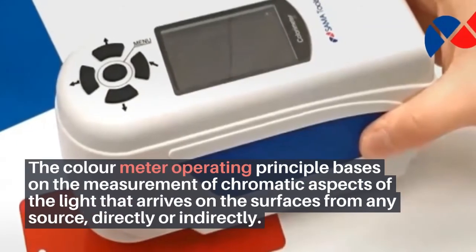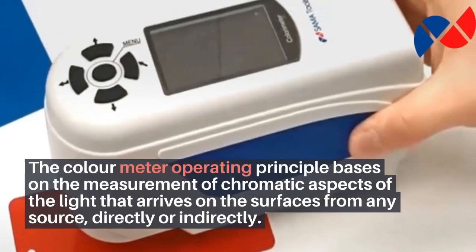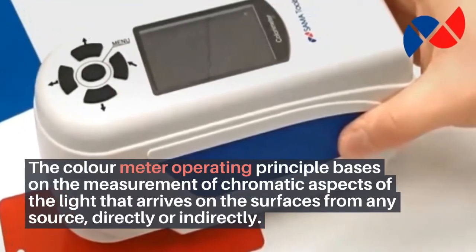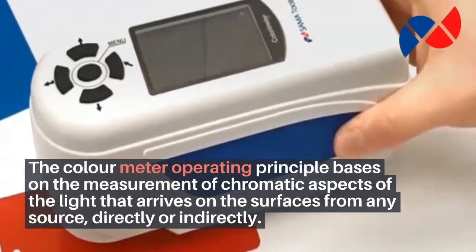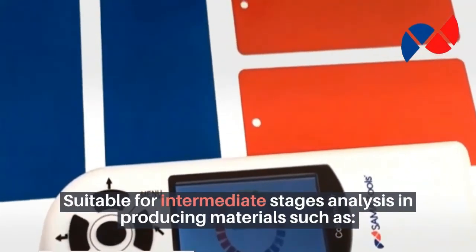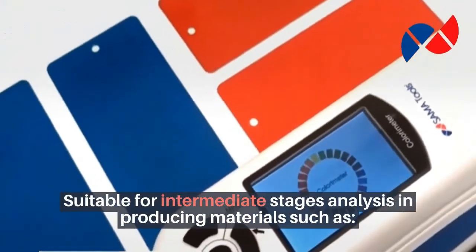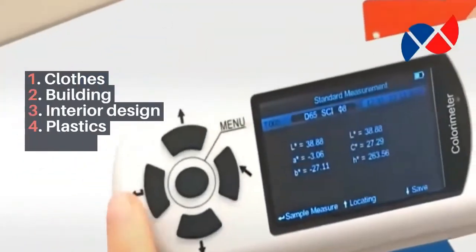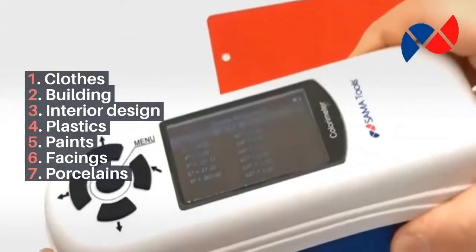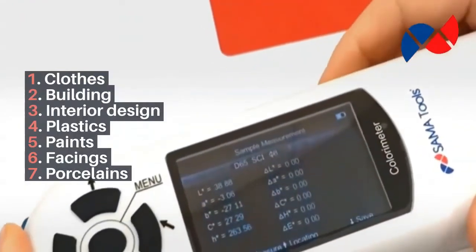The color meter's operating principle is based on the measurement of chromatic aspects of light — the light that arrives on surfaces from any source, directly or indirectly. It is suitable for intermediate stages analysis in producing materials such as clothes, building interior design, plastics, paints, facings, and porcelain.